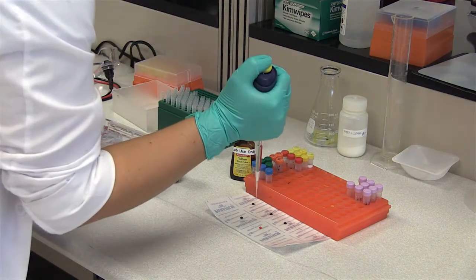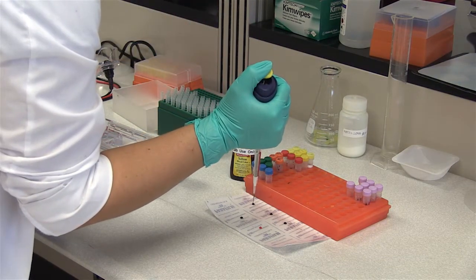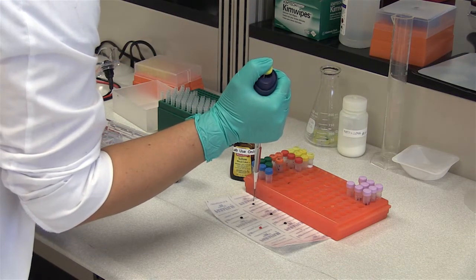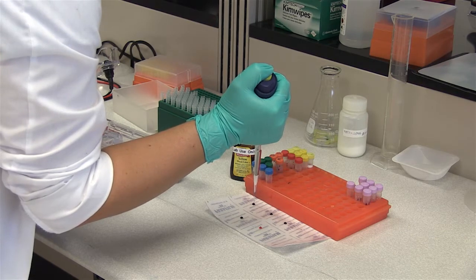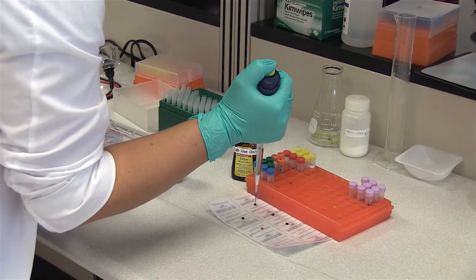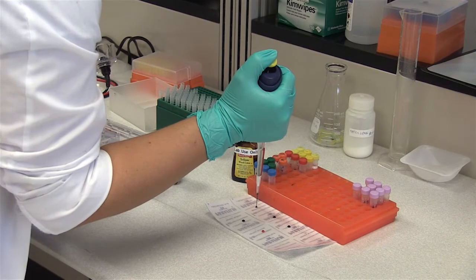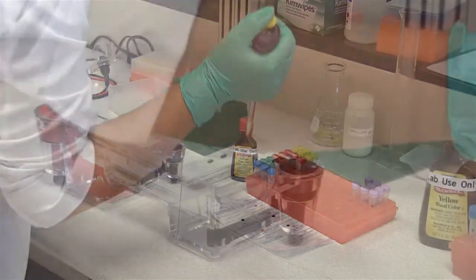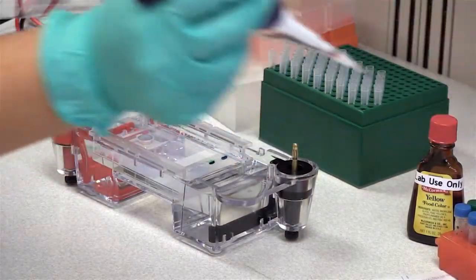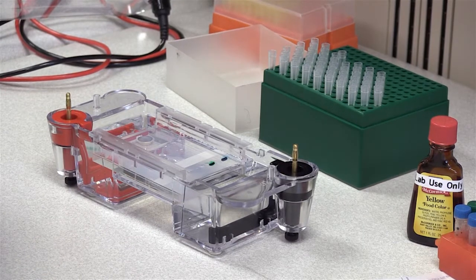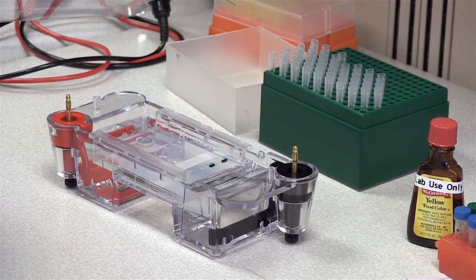Alright, everybody ready? You want to make sure that you don't have any bubbles. Notice that when I'm drawing the sample up, I'm getting a nice, full, solid sample. There's no bubbles. There's no open space.